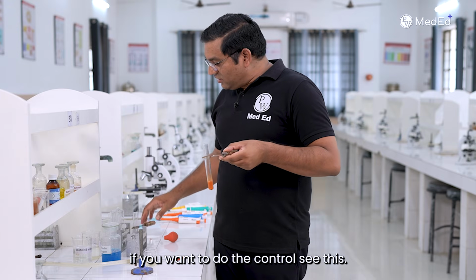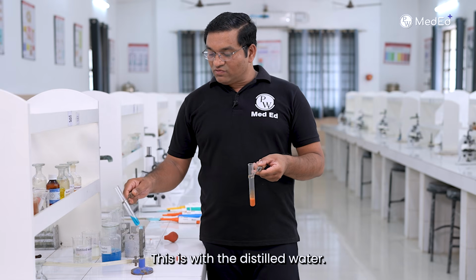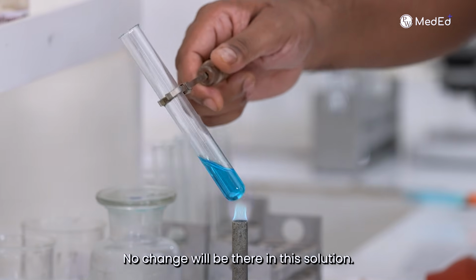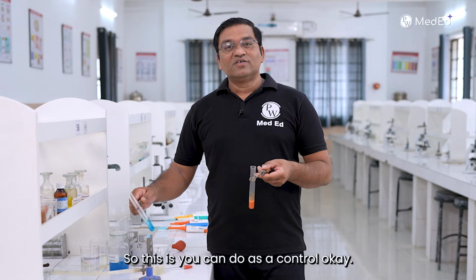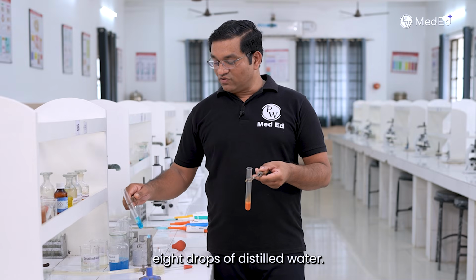Now see, if you want to do the control, this is with the distilled water, no change will be there in this solution. So you can do this as a control, okay, by adding 8 drops of distilled water.